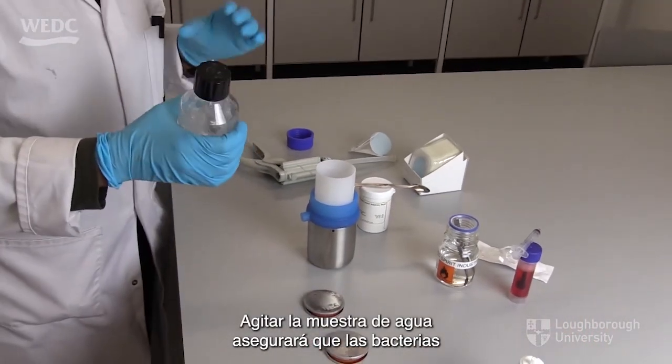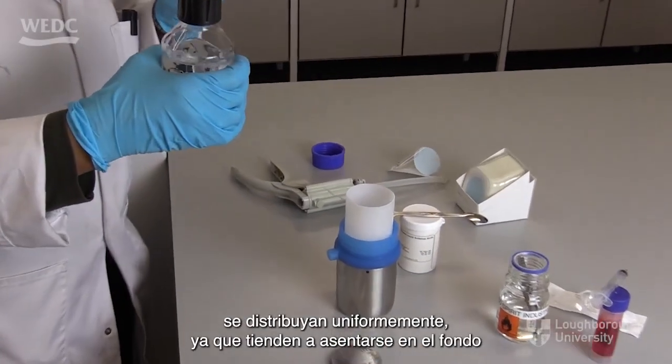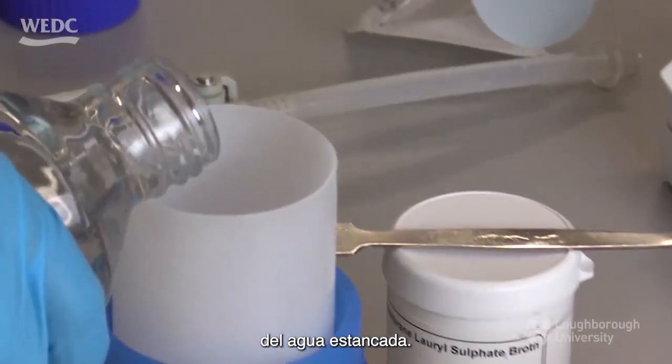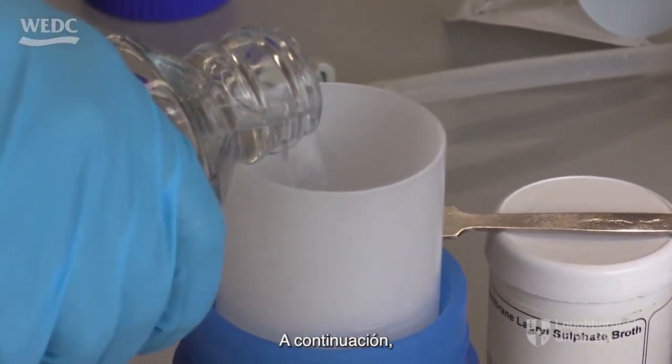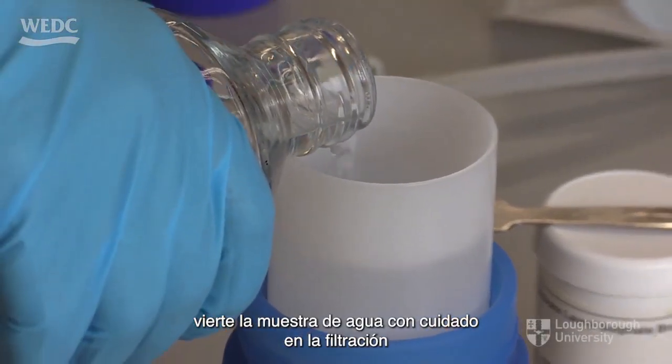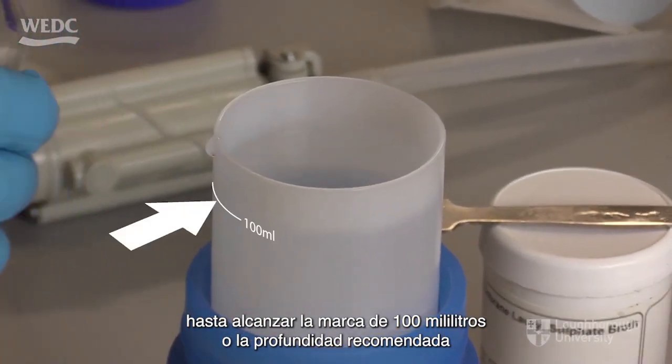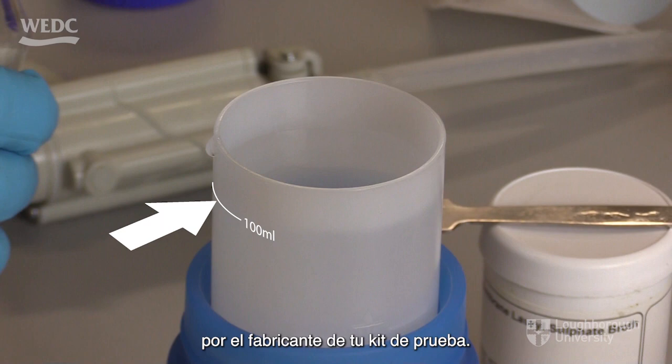Shaking the water sample will make sure that the bacteria are evenly distributed, as they tend to settle at the bottom of standing water. Next, pour the water sample carefully into the filtration unit until the 100 milliliter mark is reached, or to the depth recommended by the manufacturer of your test kit.